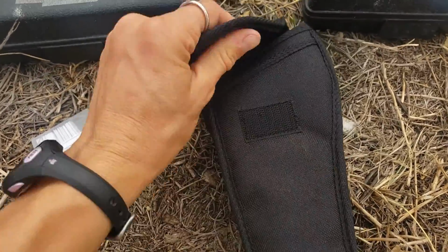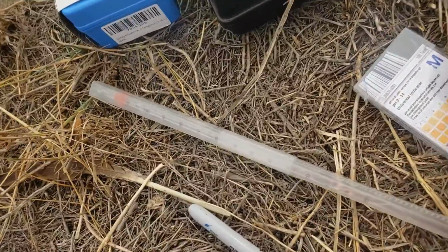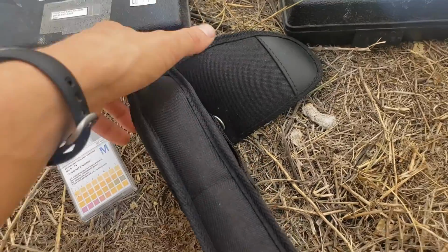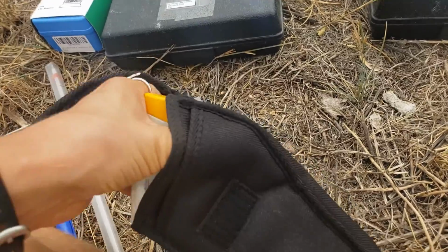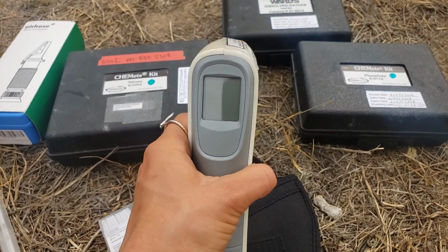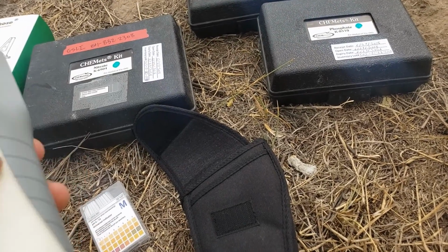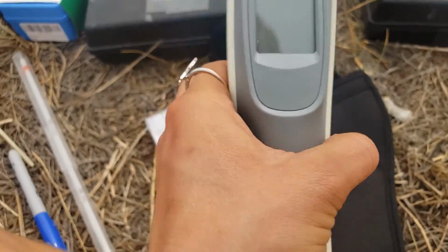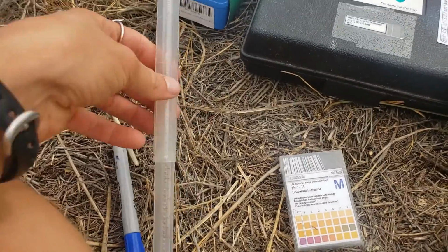First, let's just start with temperature. This is maybe one of the easiest things that you can measure if you don't have all these fancy tools. So you might use a thermometer to measure that. But if you do have fancy tools, this is one of my favorite fancy tools, which is a temperature gun. Okay, so this, you just don't shoot it in people's eyes, right? But let's see, I hope mine is, oop, we maybe need more batteries, which is awesome because we have the mercury thermometer instead, which sometimes gives better results in my opinion.